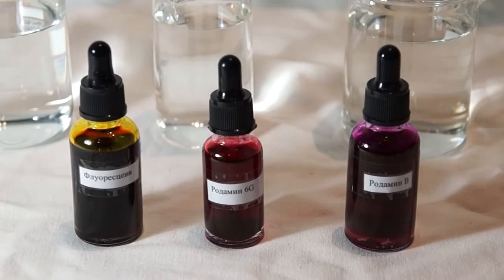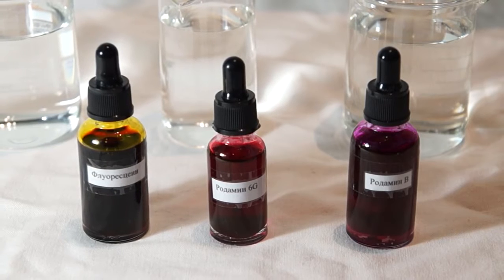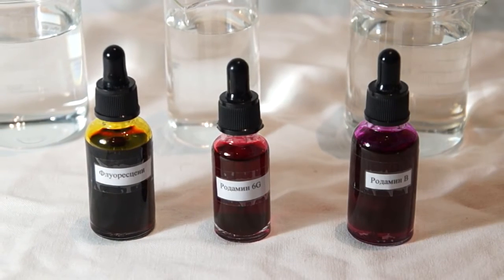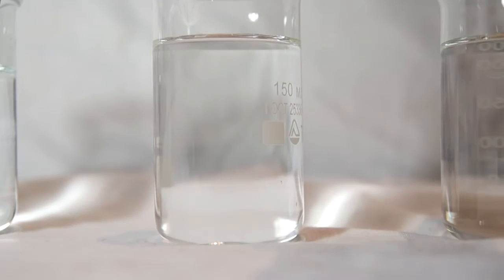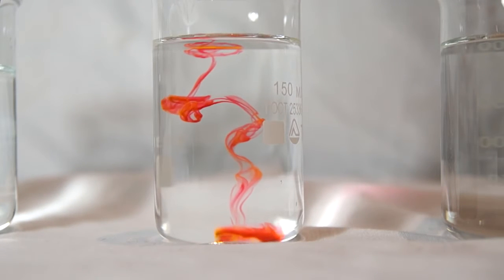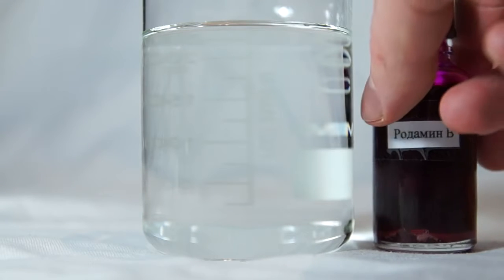For the fluorophores I will use the following materials: Fluorescein, Rhodamine 6G, and Rhodamine B. Concentrated solutions of these substances do not glow in UV light, but their dilute solutions emit light in the ultraviolet rays pretty much flawlessly.